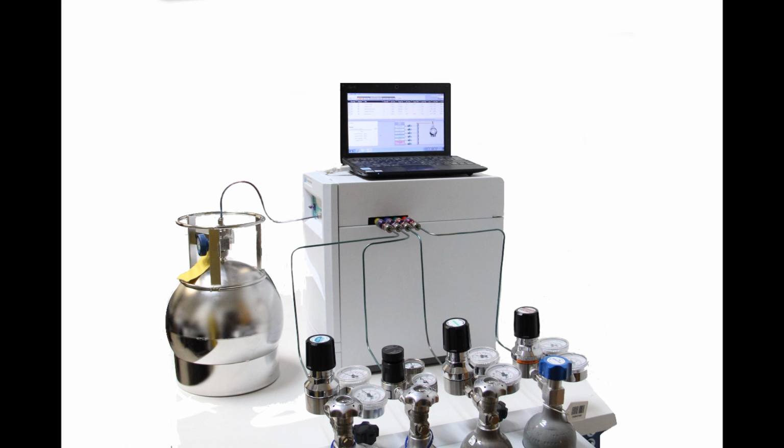My name is Harry Every, and I am a Senior Development Engineer here at Entech Instruments, and the lead programmer on the Entech 4700. Today I'm going to show you how to set up a configuration for the Entech 4700.